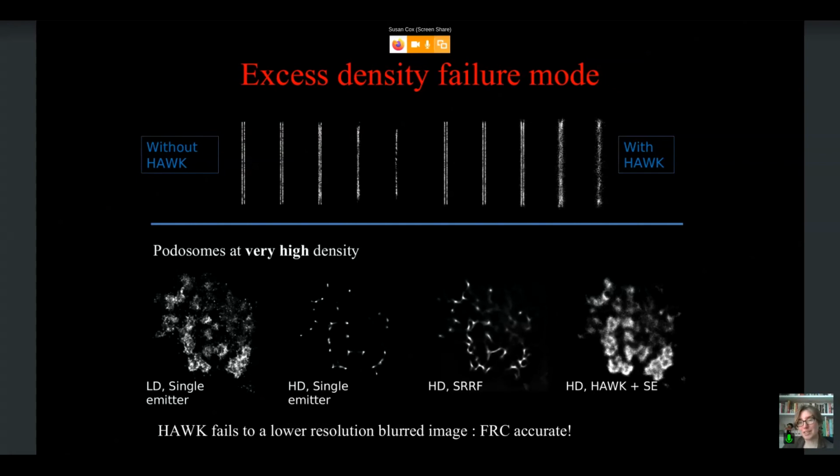But as you can see on the right bottom, what we see with the podosomes is what looks like a not particularly great wide field image. So if there is no extra resolution to be got out, Hawk should return you something that looks like a wide field image. And we actually tested this with Fourier ring correlation to see if Fourier ring correlation will then reflect the actual resolution. And it was really encouraging to find that it did. Fourier ring correlation told us that the resolution was garbage, and it looks like it's garbage visually. So that's a nice confirmation.